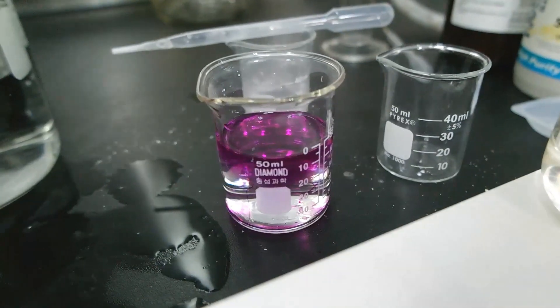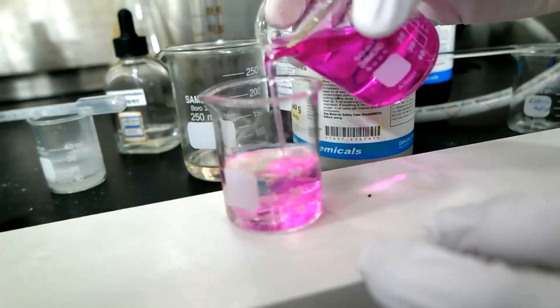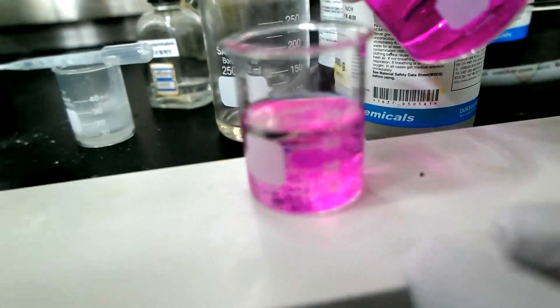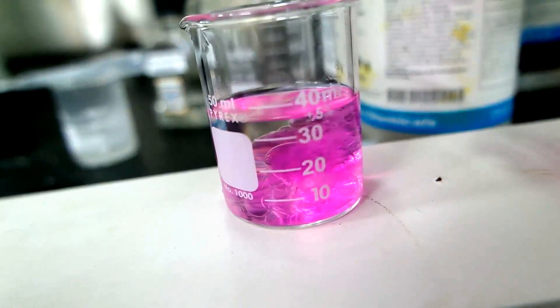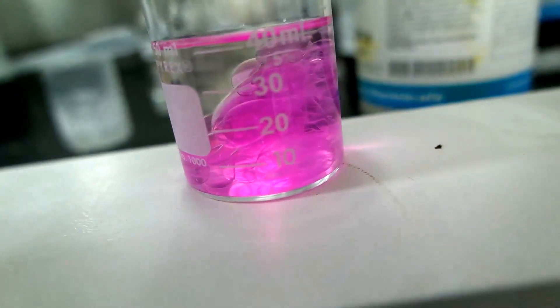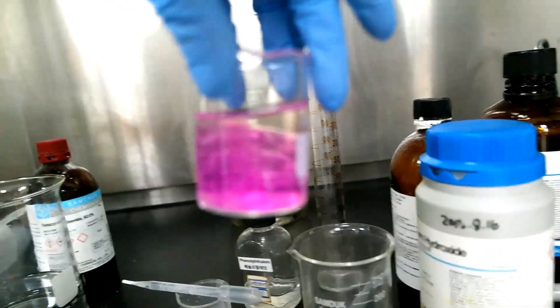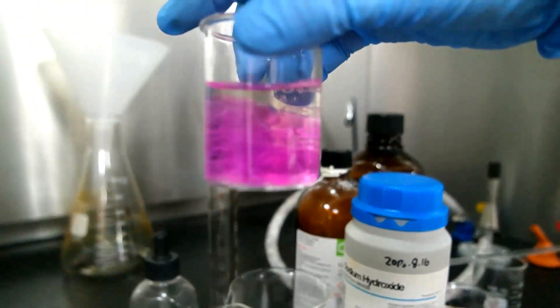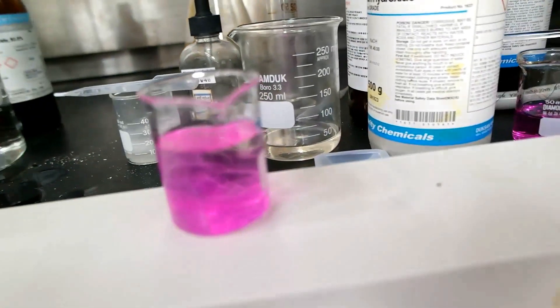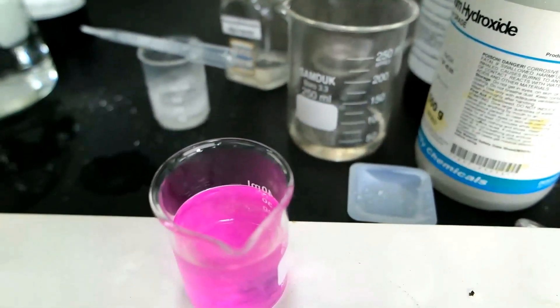And now — which layer is on top? I'm putting it in a bigger beaker — a little bit more. Woah, woah — two layers! Oh my gosh, it looks like lava! So now you need to pick it up. Are you sure this is the right reaction? I do see two layers. Let's pull it together — that's the fiber forming, the nylon that's forming.